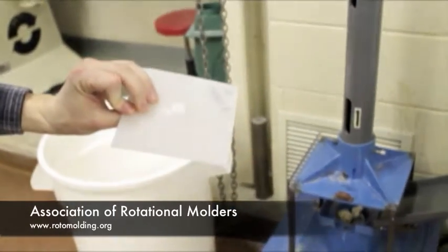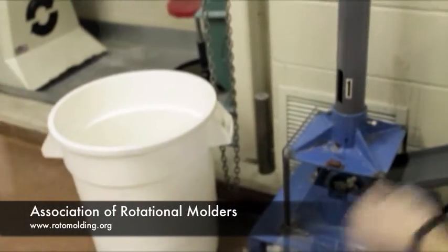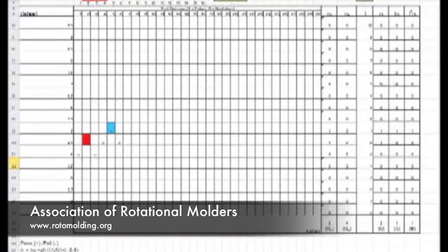If no failure occurs before 75% of the tested height, change to a heavier dart. Use a chart or database to record and clarify the outcome of each test.